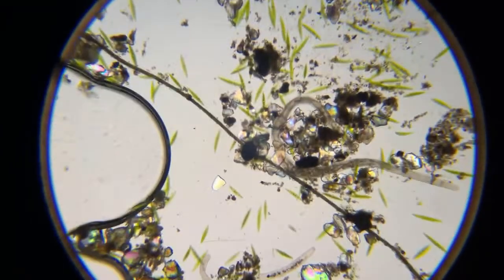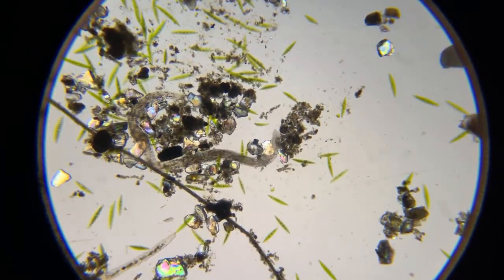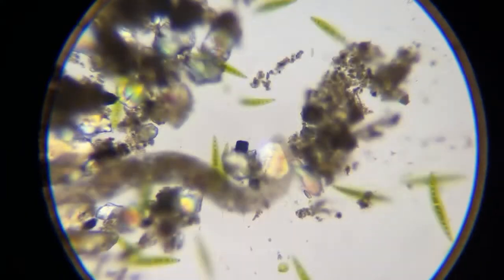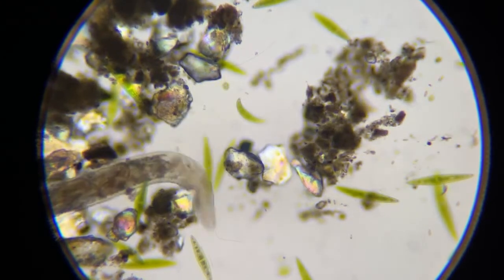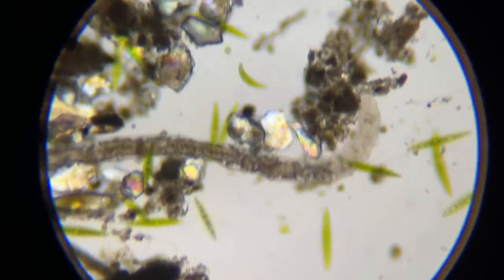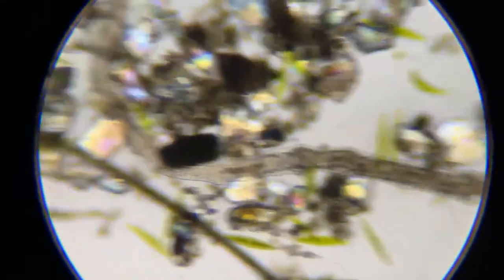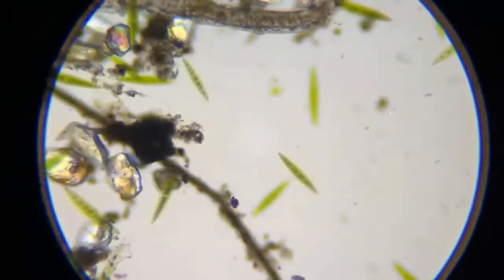Hopefully, oh, here he is. So what I'm gonna do is stream this guy. Let me go back to 100 for him. Oh, he's different. Oh no, he's the same. This looks a little different than the other guy we had. So I've never seen him today yet.